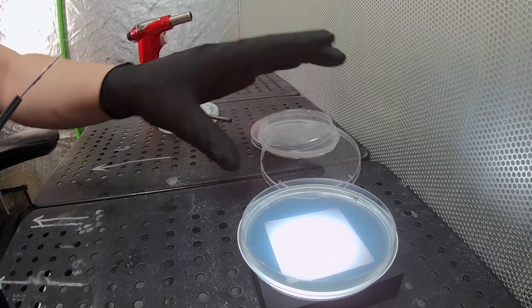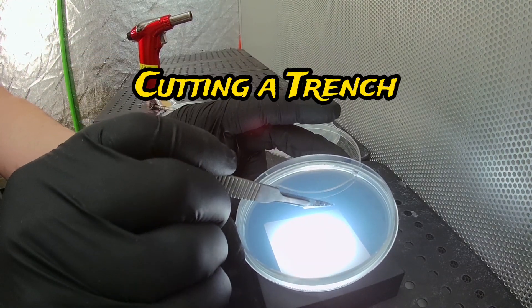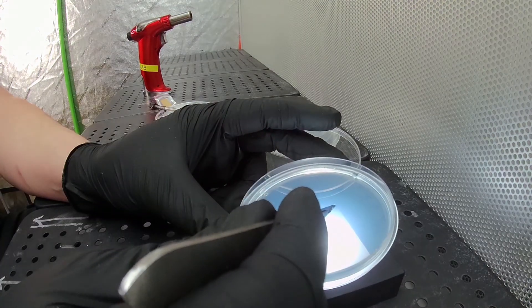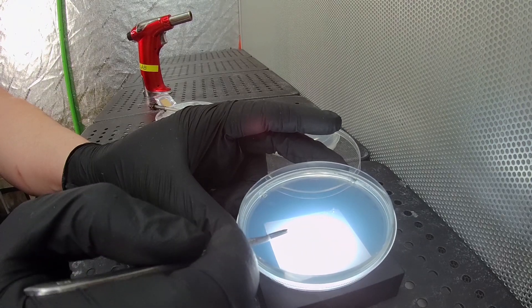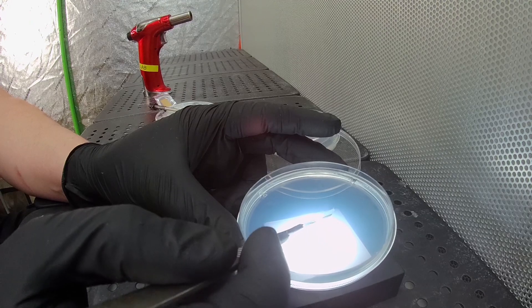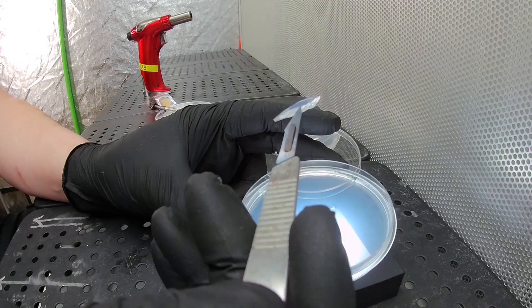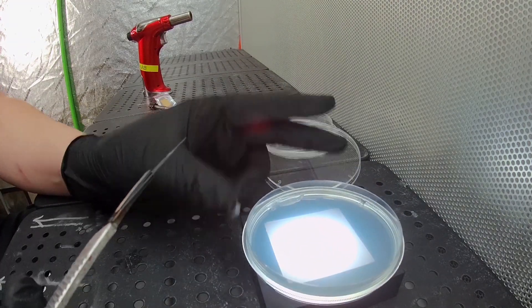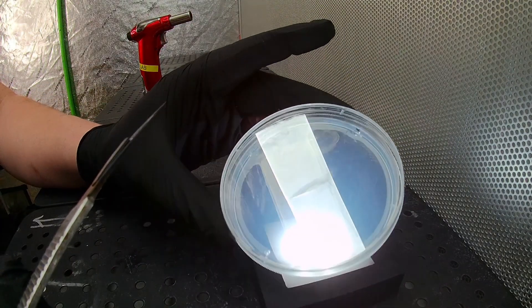First up, let's cut our little trench. All we're going to do is cut down at an angle toward the center of the plate, cutting out just a little trench. Then we remove that piece — just stick your scalpel in, pull it up. You want to try to get it whole, but as long as you get everything out of there, that's fine. Just set that aside on the plate; there's no need to throw it away. It's sterile — it can stay there on the side.